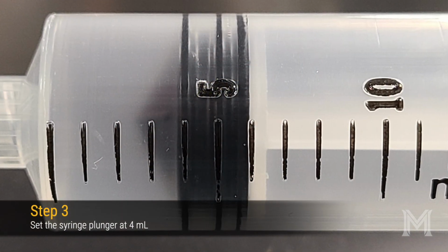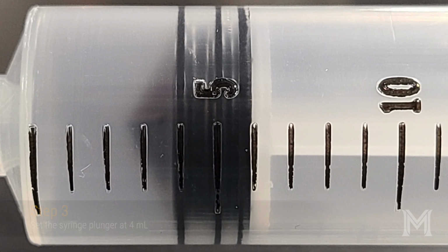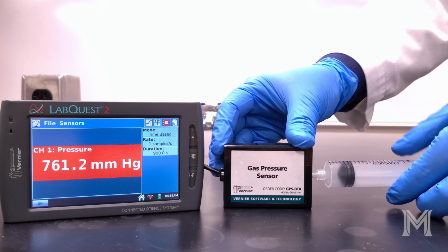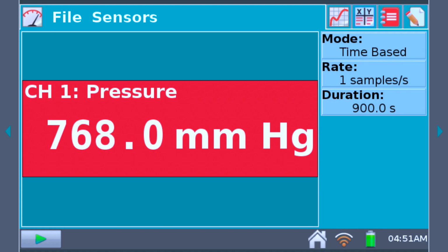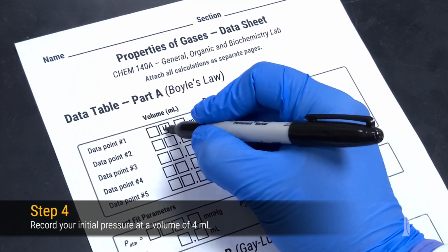Now adjust your syringe so that the leading edge of the plunger lines up exactly with the 4 milliliter marking on your syringe. Attach your syringe directly to the gas pressure sensor. Carefully twist the syringe clockwise, being careful not to over-tighten or to damage the connector on the pressure sensor. Wait for the pressure reading to stabilize and record the value on your data sheet.